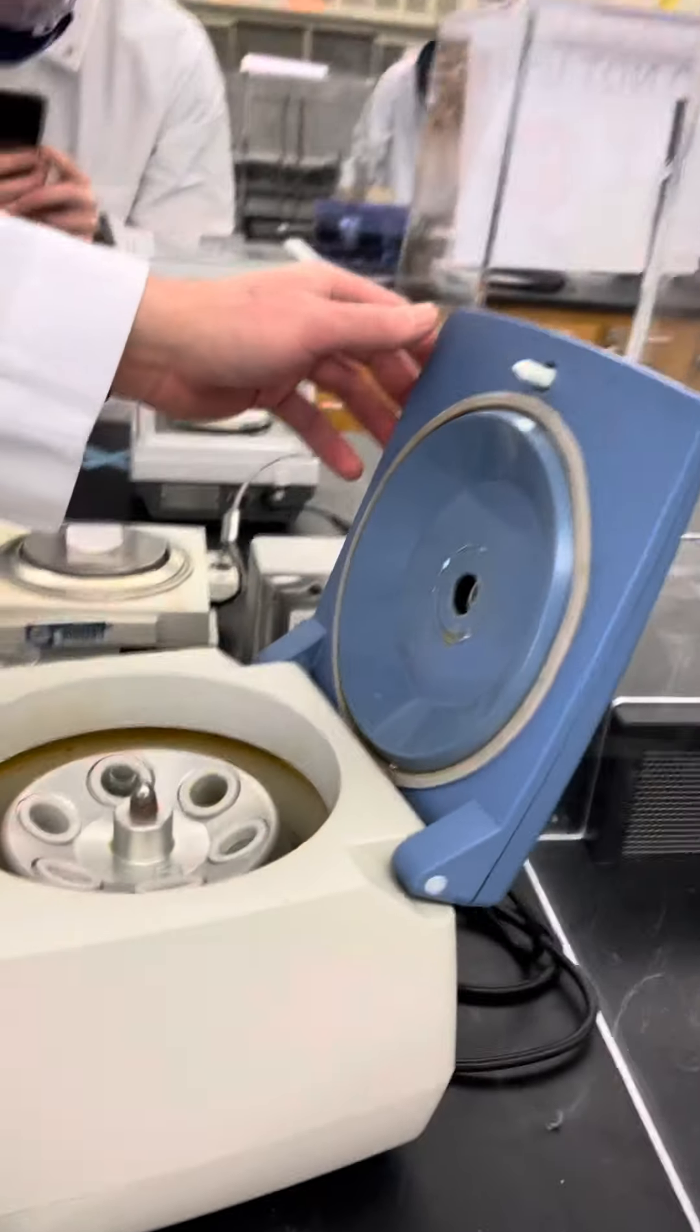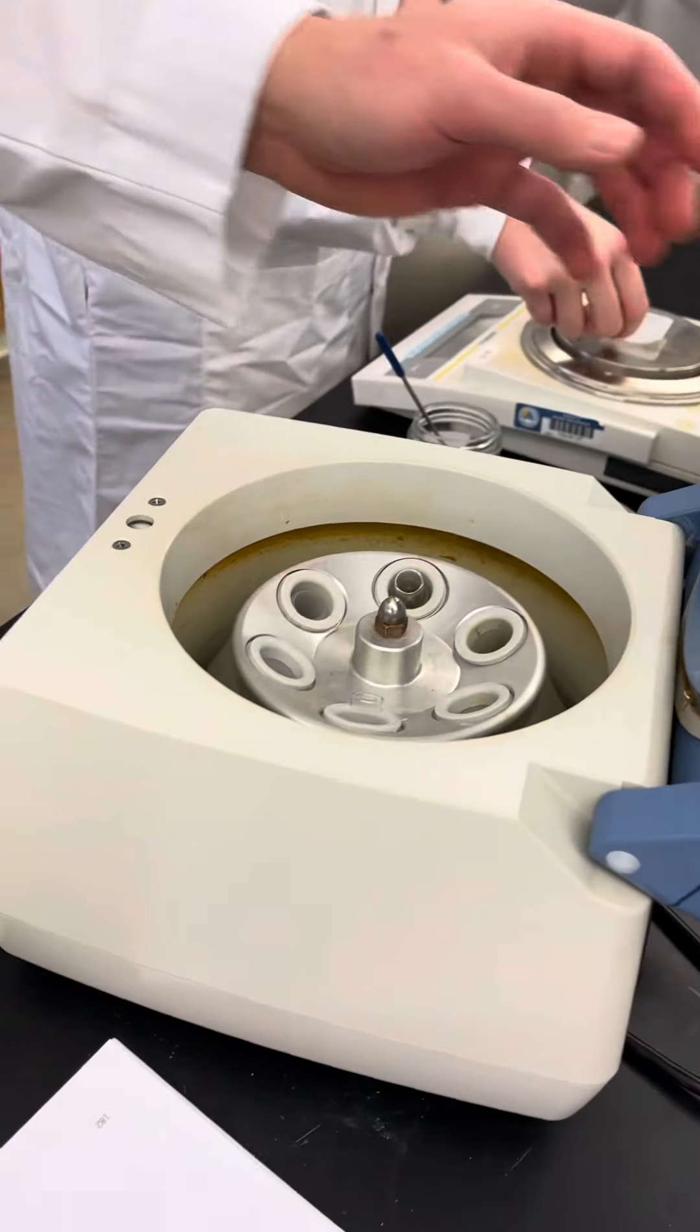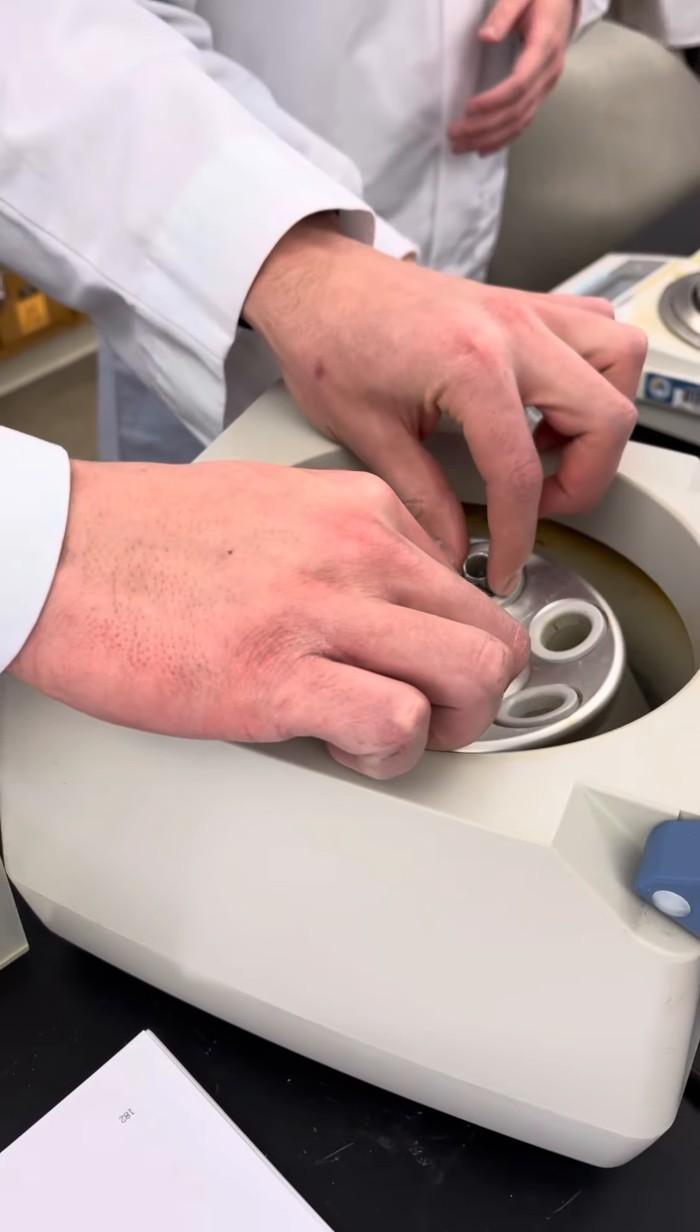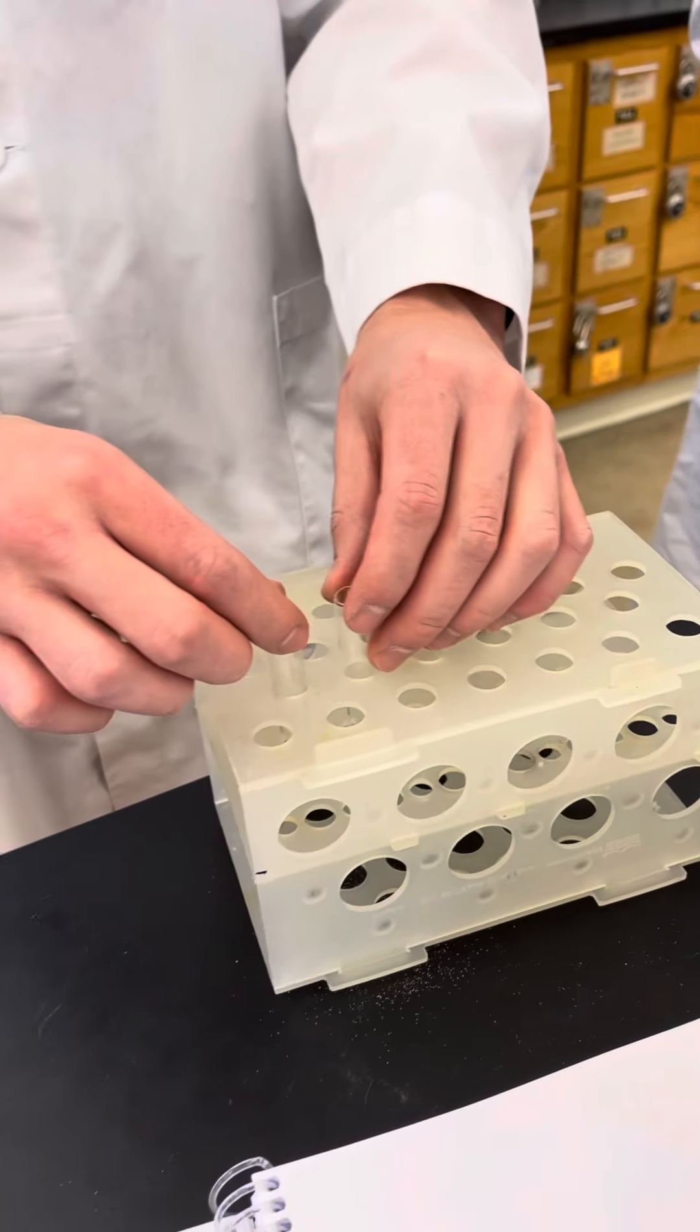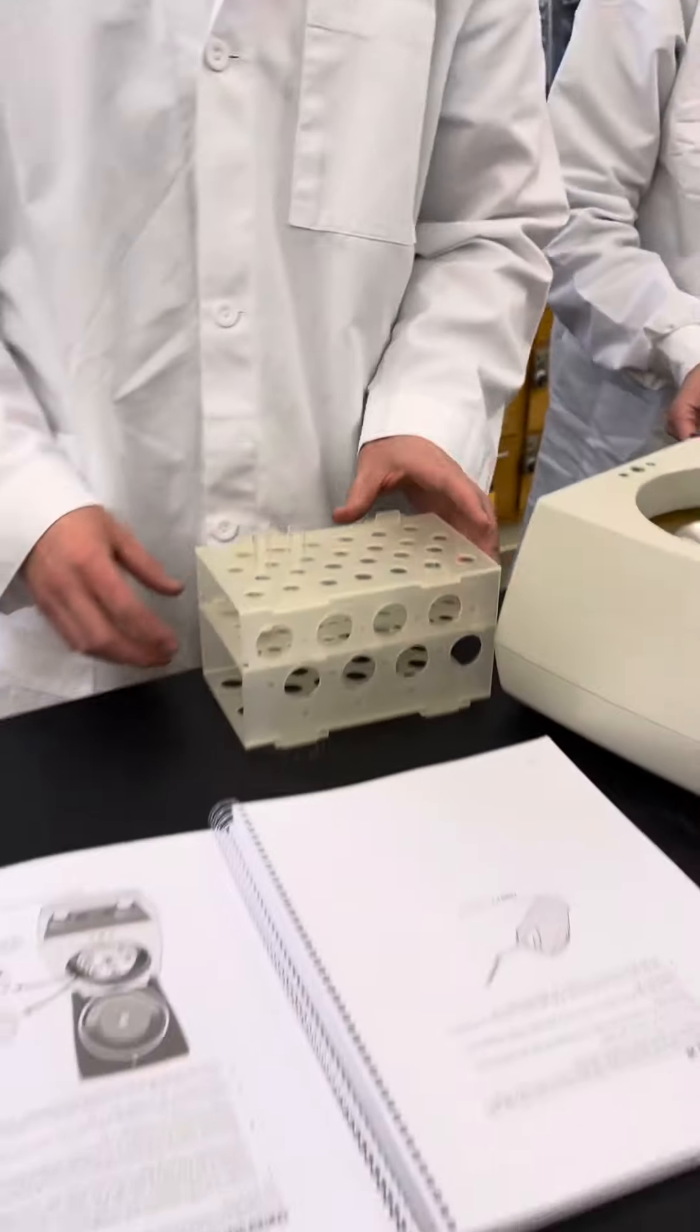And now, we're going to take it out. Scoop some sand. That's how you centrifuge.